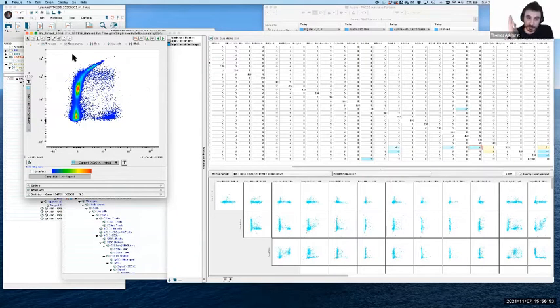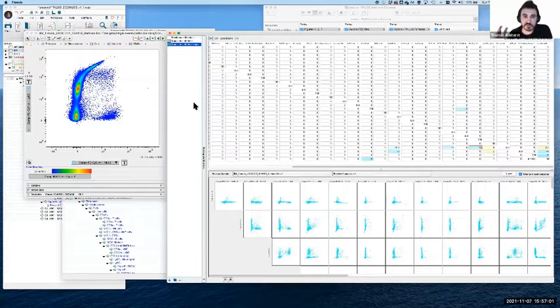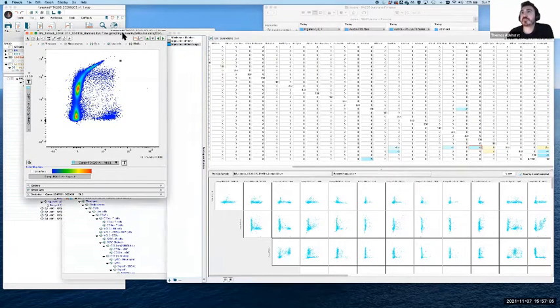It is absolutely better to go and solve that in the lab to make sure the assay is solid, but in your data, if that needs to be corrected, this is how we can do it in a fairly simplistic way. Obviously, if you're using FlowJo, it'd be different in other software, but it behaves the same way. Positive numbers move it across, negative or lower numbers move it to the right. And we should do that in a way that's methodical, relying on the FMOs and the single stain controls to inform our decisions so that we can validate what we're doing.